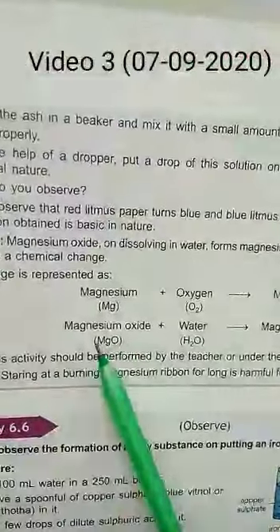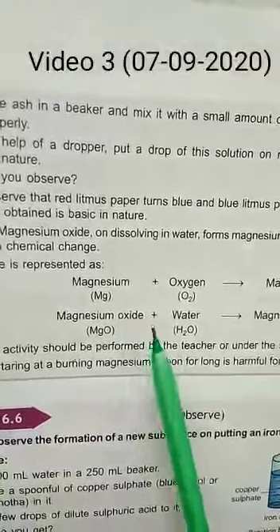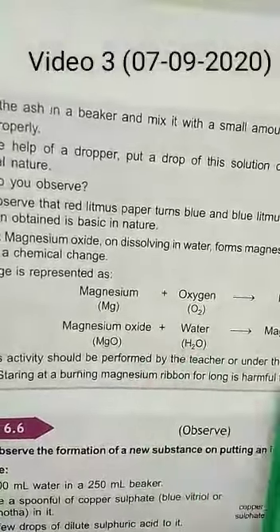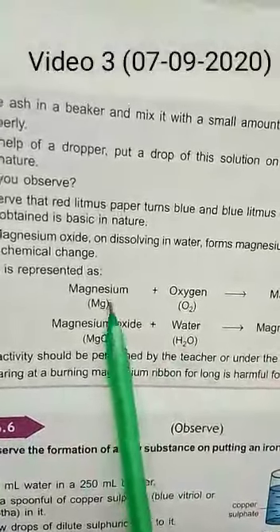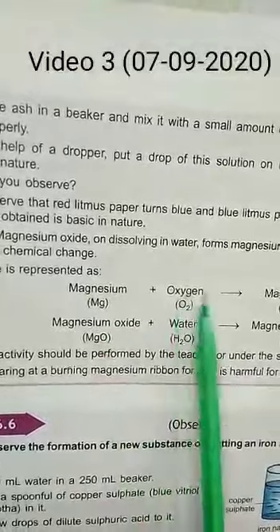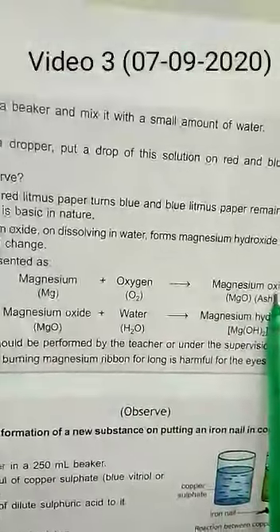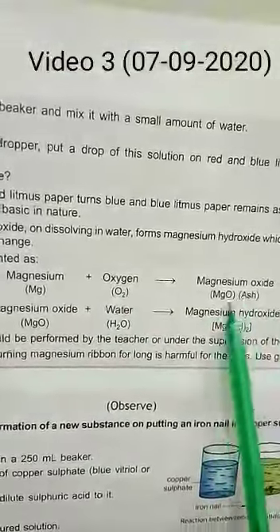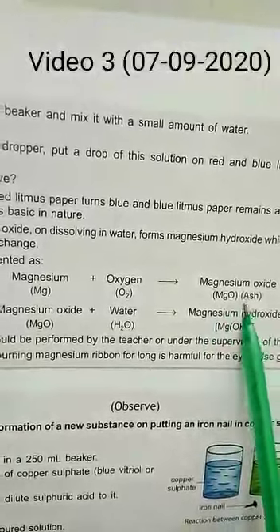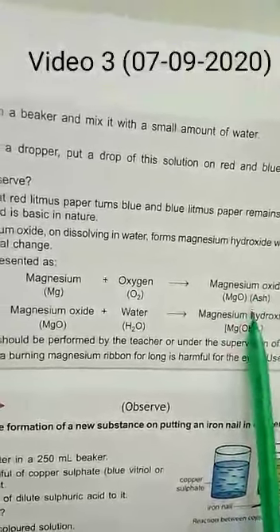We are observing a chemical change, so a chemical reaction is happening. Magnesium burns in the presence of oxygen and converts into magnesium oxide, MgO, which appears as ash.